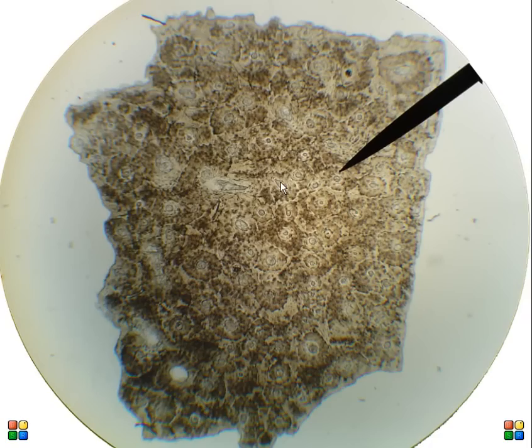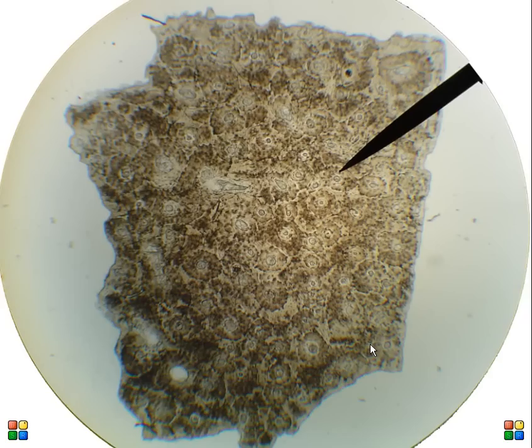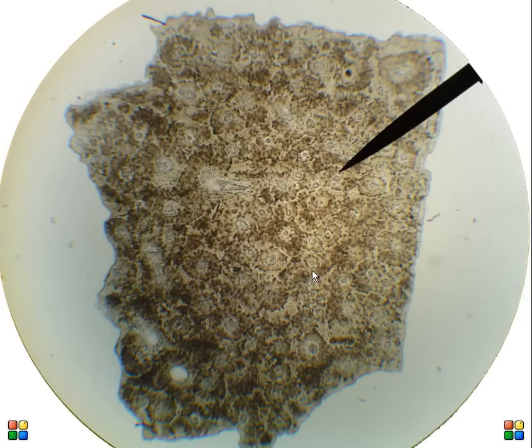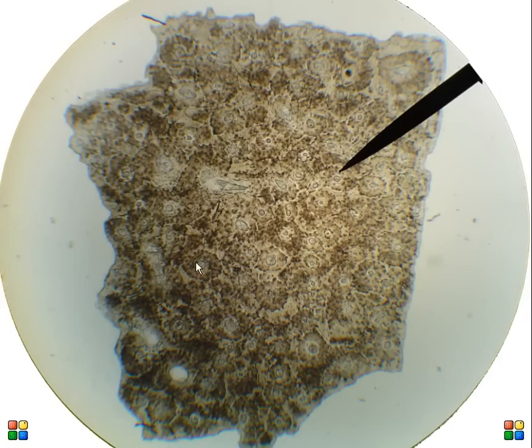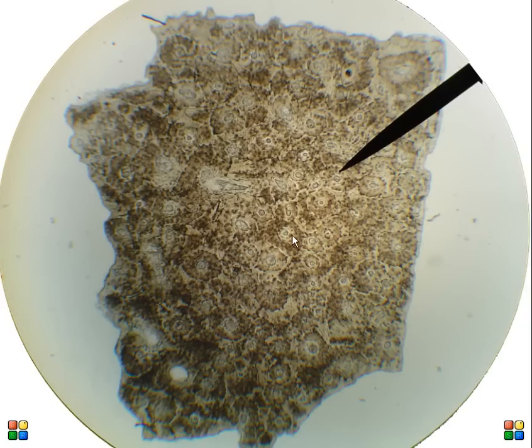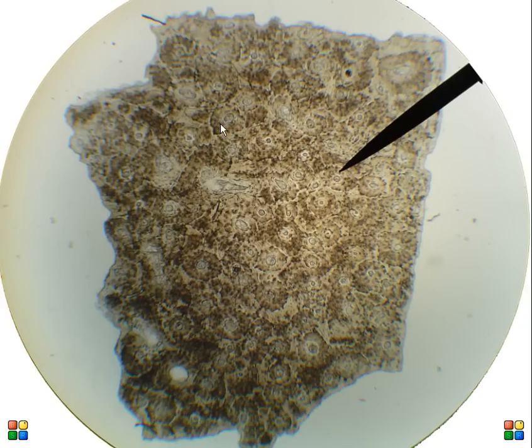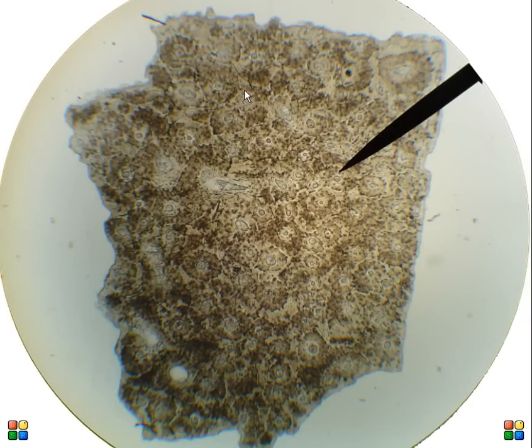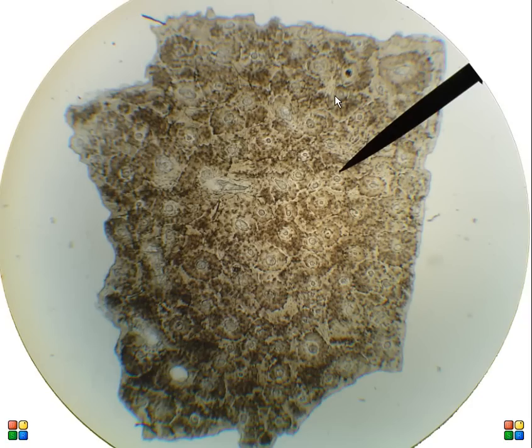This slide has ground bone on it, so this is hardened bone with the calcium still in it that you're seeing under the scope, and this is 40 times magnification. These individual tree ring-like structures that you see are called osteons, and for dense bone that's the major structural component — these osteons.